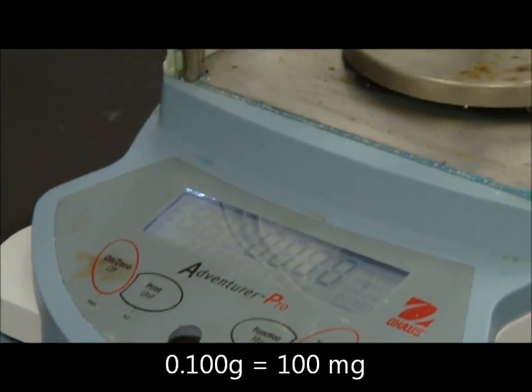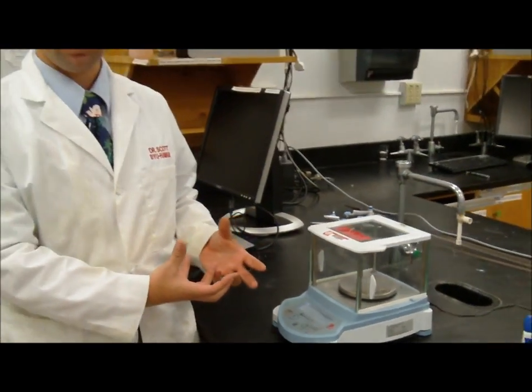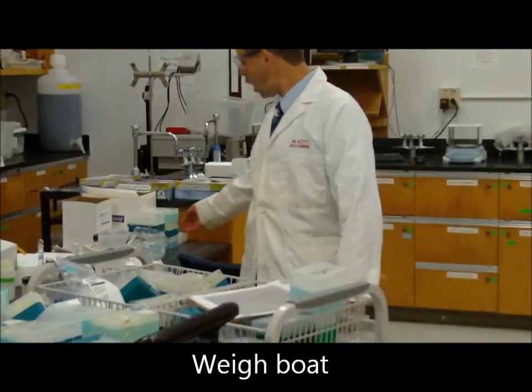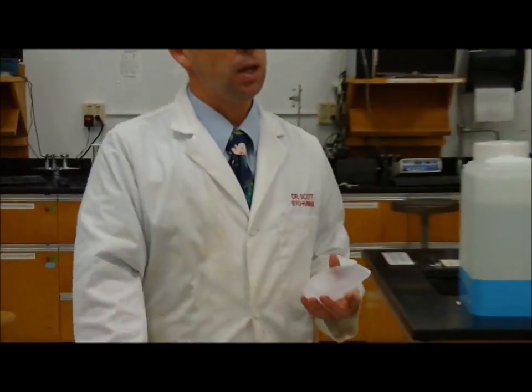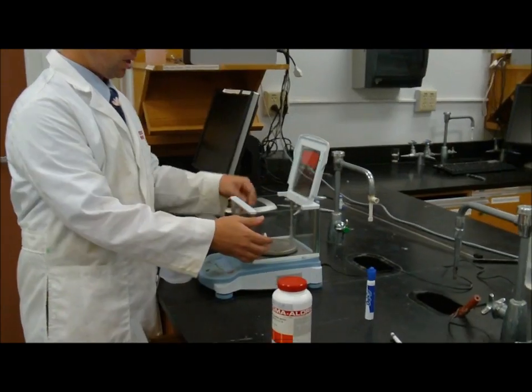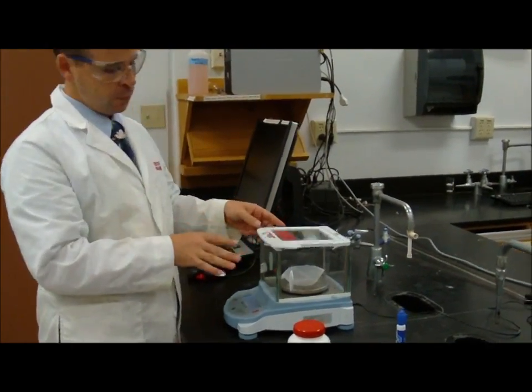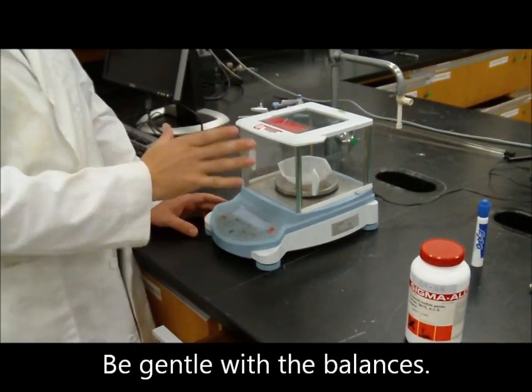All right? When we weigh things on here, if we're weighing out a chemical, then we need to have a container which we weigh it in. That container we call a weigh boat, and we have a variety of them over here, different sizes depending on how much you're going to weigh out. So I grab myself a weigh boat, I bring it over here. I have 3 different doors that I can open. I don't need to open them all, depending on how I'm going to put this onto the pan. I want to be careful when I place things onto the pan not to drop them too hard or push onto the pan or disturb the pan.